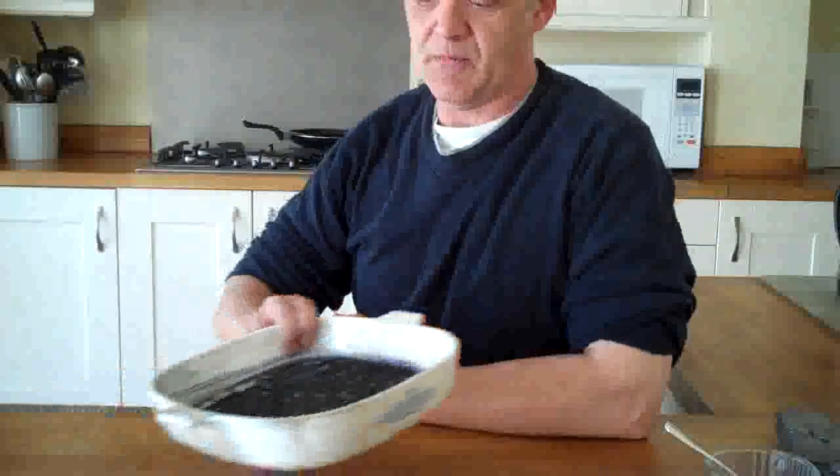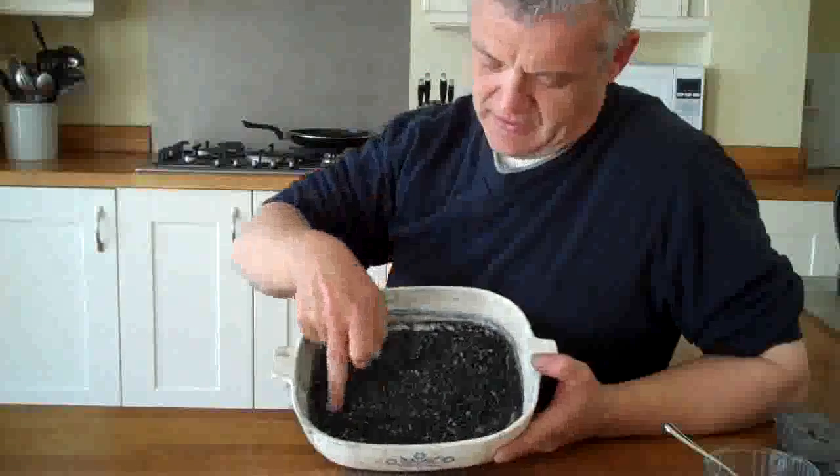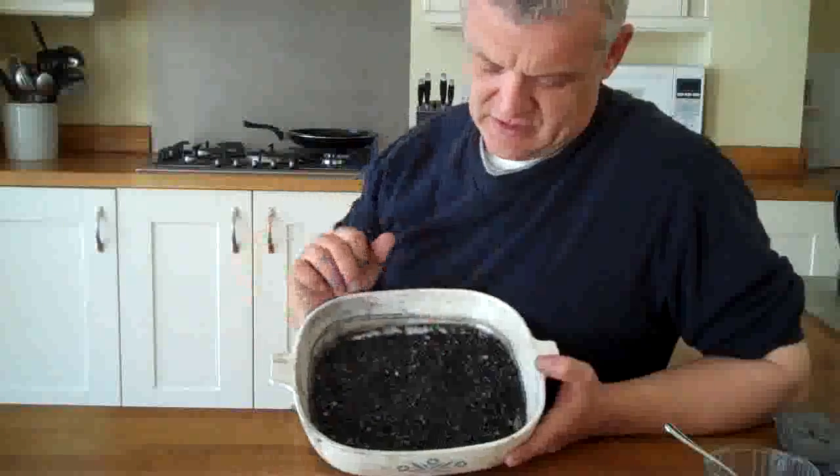And the water's going brown because there is an oxidation reaction that's gone on, and that water is going to be full of graphene oxide. And most of your graphite, your intercalated graphite, will settle at the bottom. You pour off the brown, wash it again, and collect the intercalated compound, because that's what we're interested in this particular thing. Now, I've made 100 grams of it, and this is the stuff when it's actually been dried.